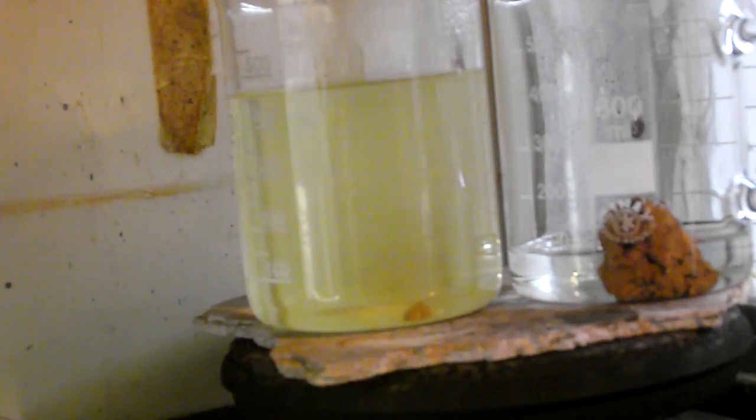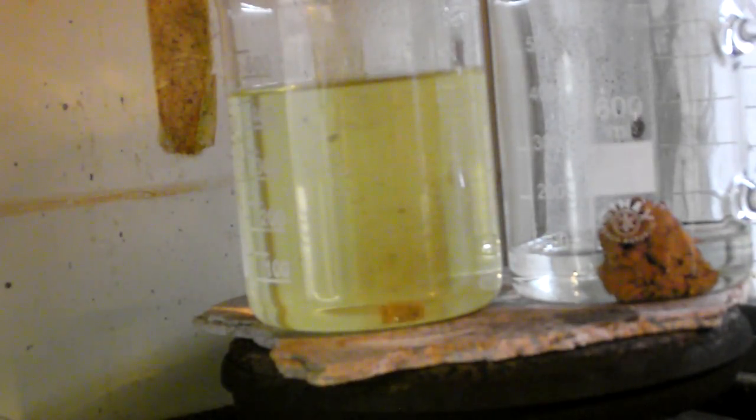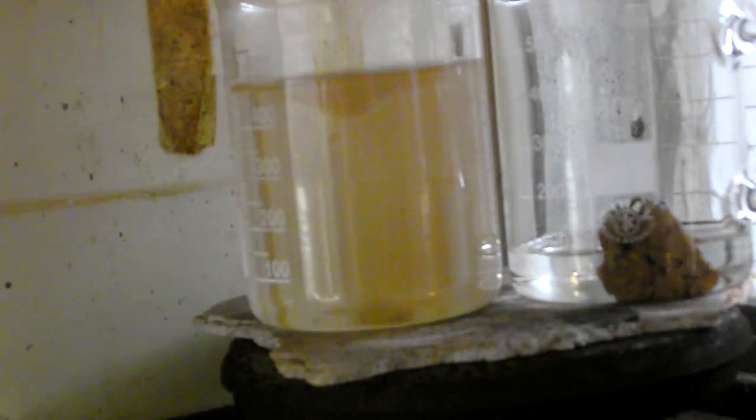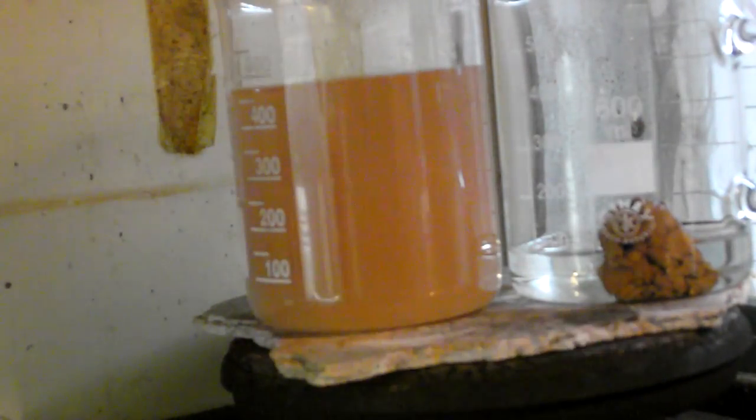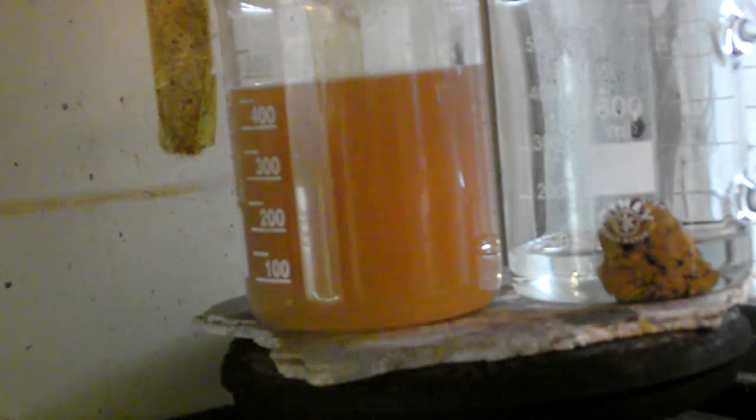But the color was still not to my liking, so I added a couple of potassium hydroxide flakes to the boiling solution. That was very stupid of me since the reaction was violent; the flakes almost jumped out of the beaker.